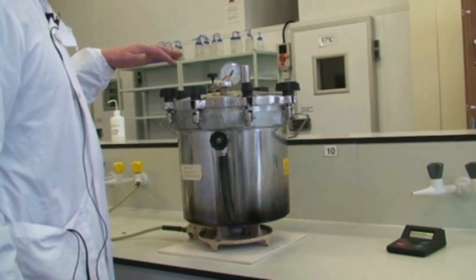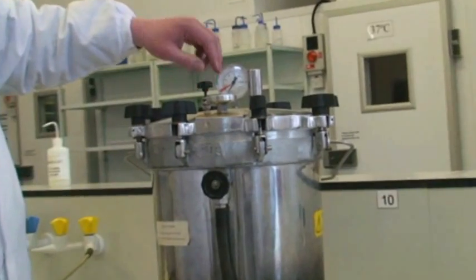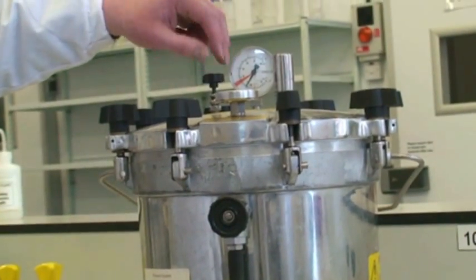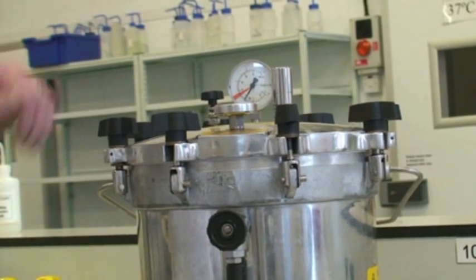OK, so now the autoclave has been venting for a couple of minutes, so we can now close this valve, taking care not to touch any other part of the autoclave as it will burn you.